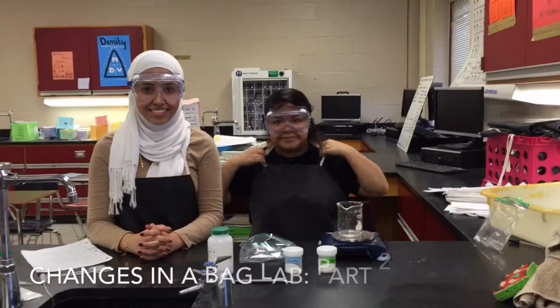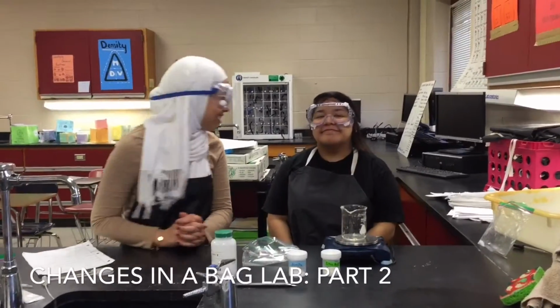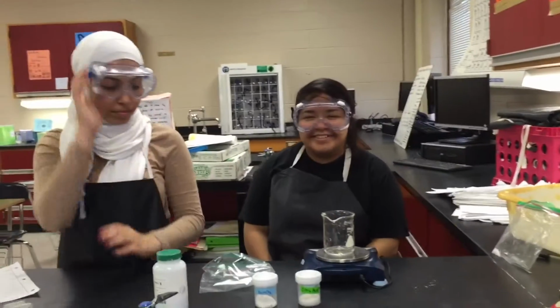Part 2 of changes in a bag lab. Now before we do this, I want to remind y'all again to always be safe, wear your goggles, your apron, and tie your hair back. Closed-toed shoes also. Step 1 to part 2.